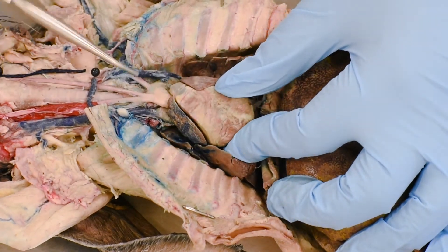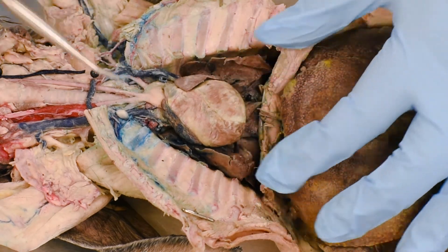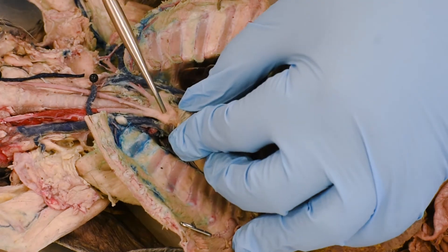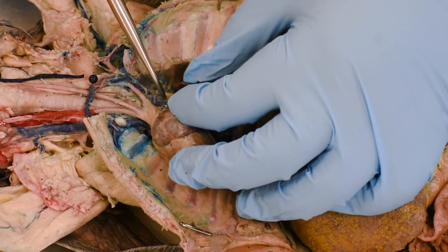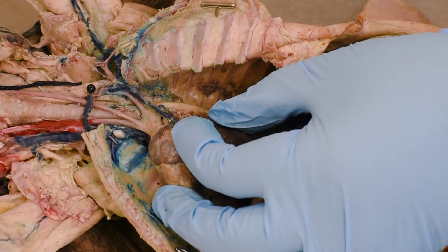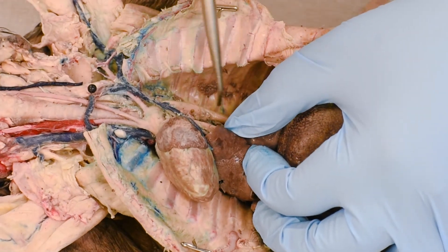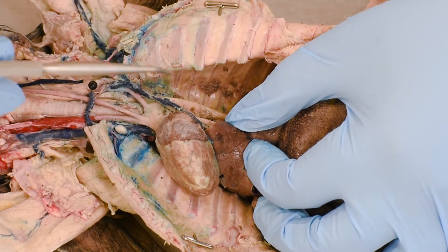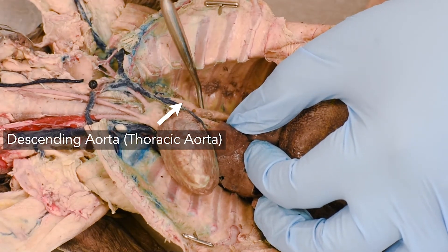We will now start following the inferior region from the heart, still in the thoracic cavity. You can distinctly see this is the arch of aorta. After the arch, the aorta starts going down posteriorly. In this region, this is called the descending aorta because now it will take blood to the inferior part of the body.